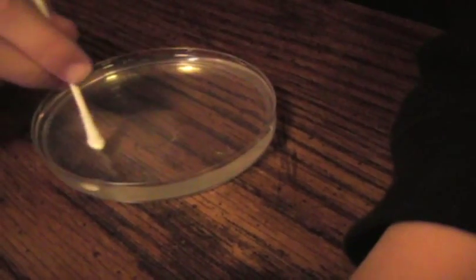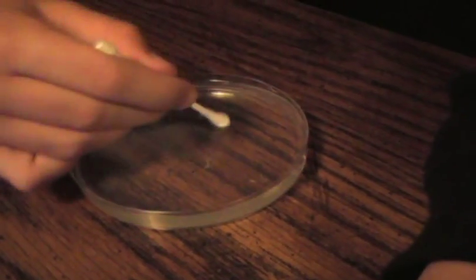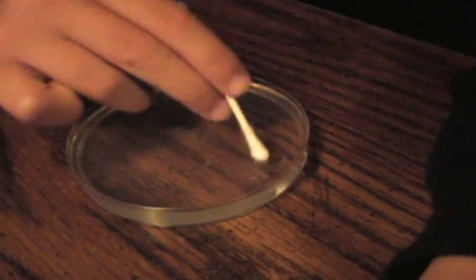Alright, we have one more here. I'm just going to gently rub it all over. It doesn't look like we're doing anything, but we're actually leaving some microscopic bacteria on there. And then we're going to set these aside for a few days and see what happens. Hopefully, we can grow some bacteria.